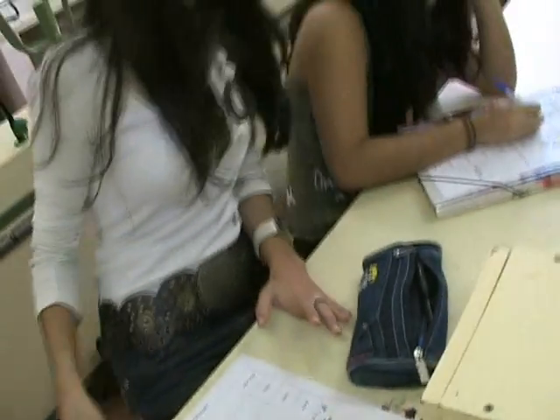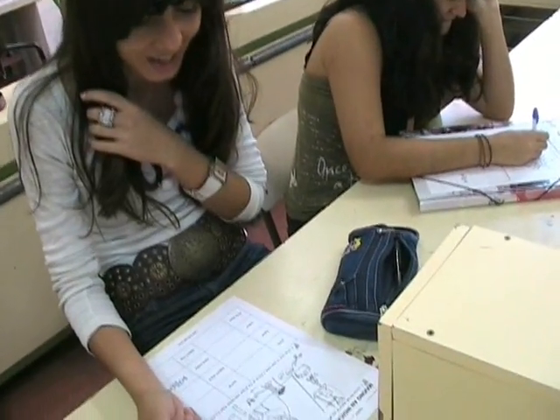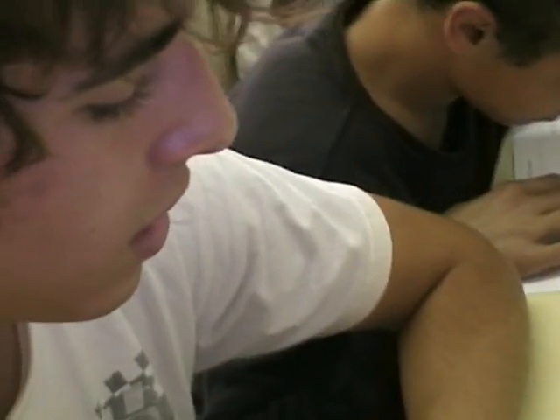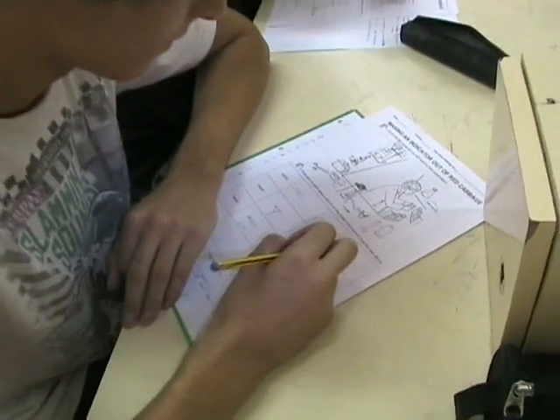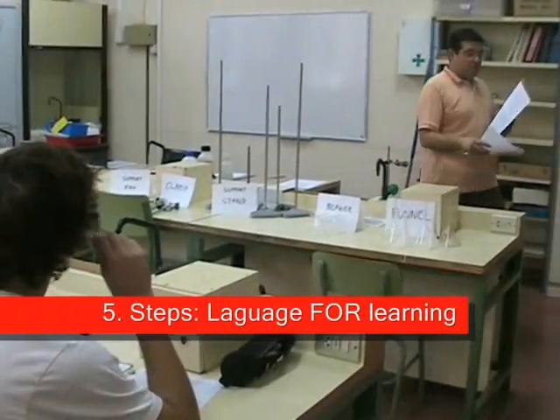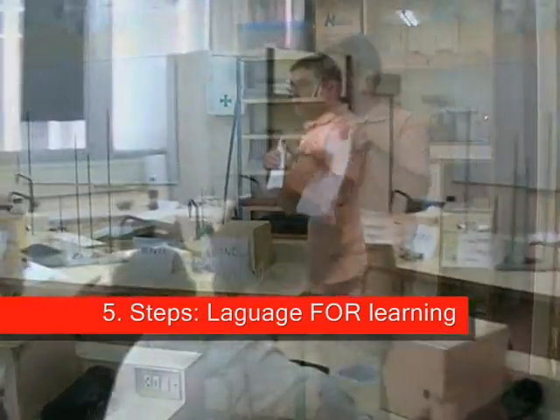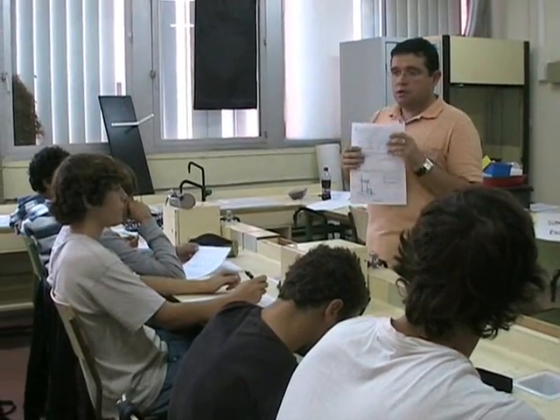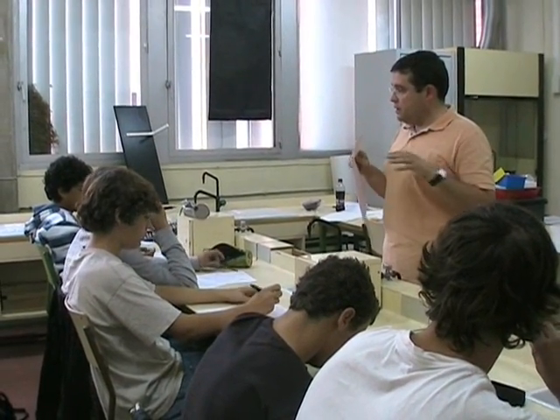The instruments you need are: mortar, support ring, support stands. What are you doing, Gerard? I drew the material of the experiment.